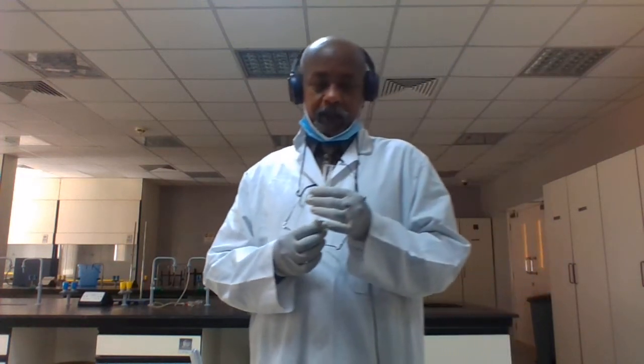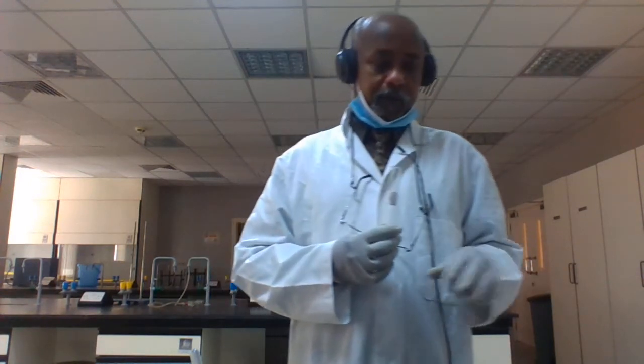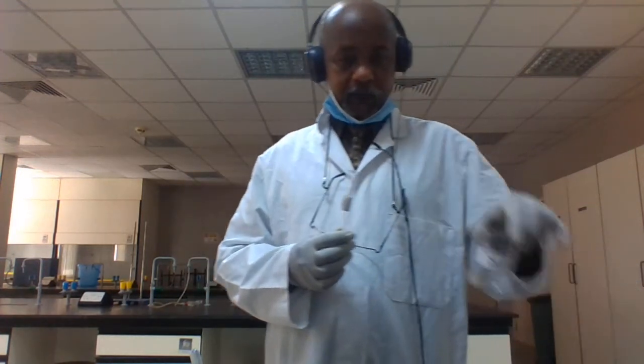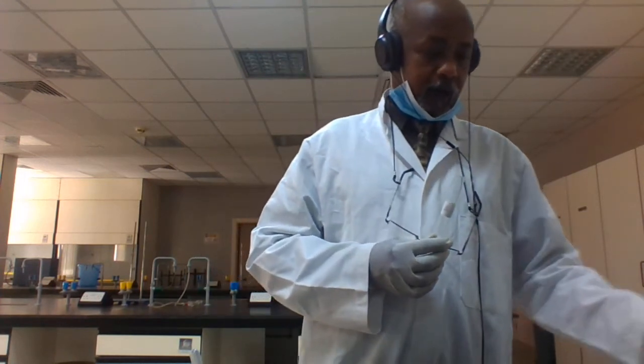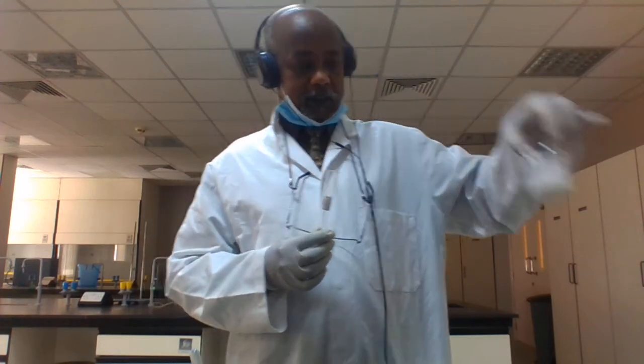Then after this, you have to identify your four samples. Now, from samples 1, 2, 3, 4: I already tested sample 1 and found carbohydrate monosaccharide in it. Sample 2 I tested and starch is there.